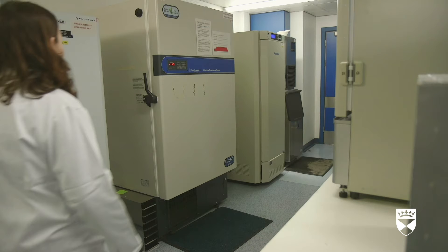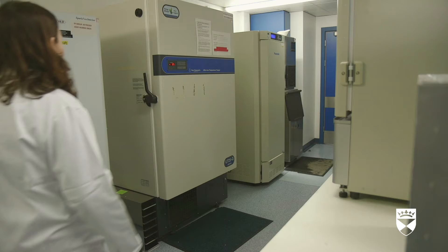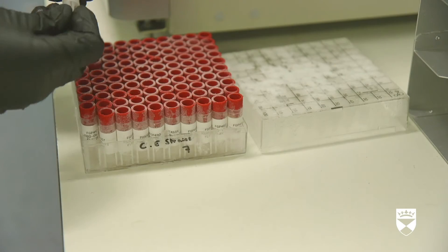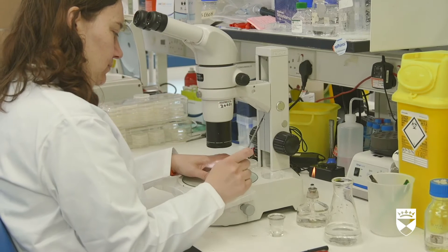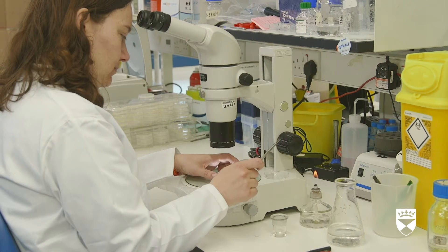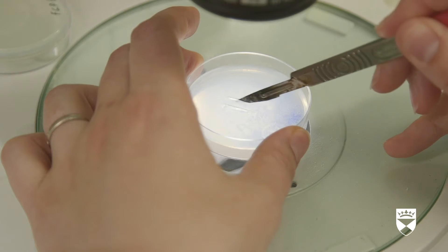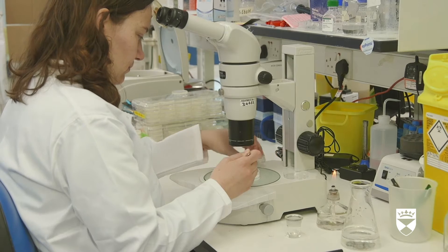The scientist removes a tray of sample tubes from a freezer and then removes a frozen sample from one of the tubes. Worms can be frozen for months or years in minus 80 degrees Celsius freezers, which is extremely handy for our research. When we need a specific type of worm, called a strain, we just thaw them. We grow these worms in plastic plates containing some basic nutrients and their food — bacteria — and keep them at their normal living temperature of 15 to 23 degrees Celsius.